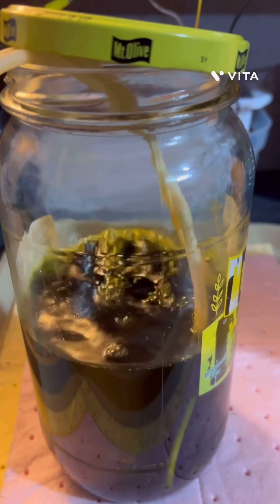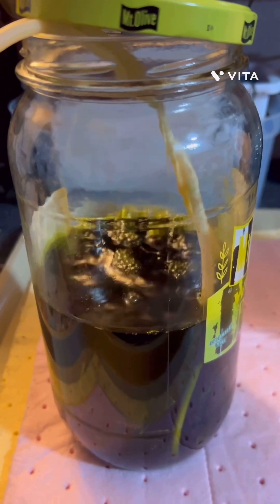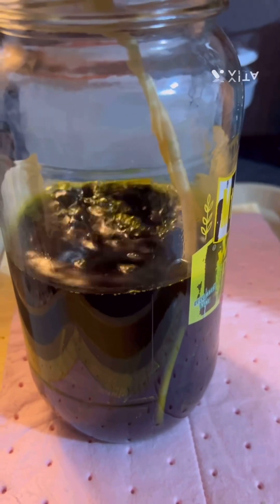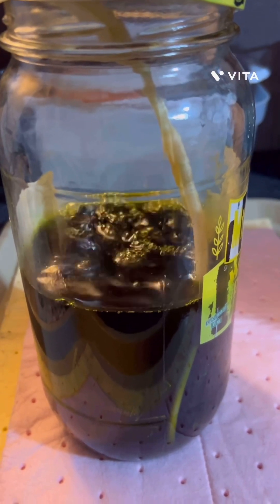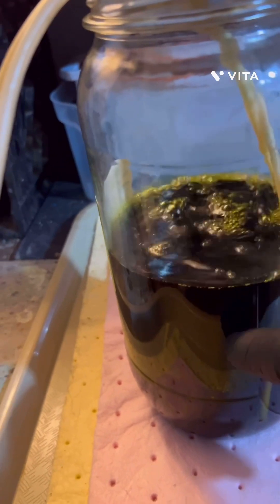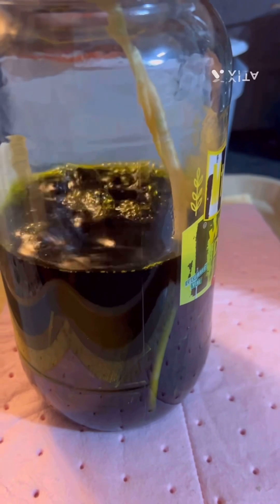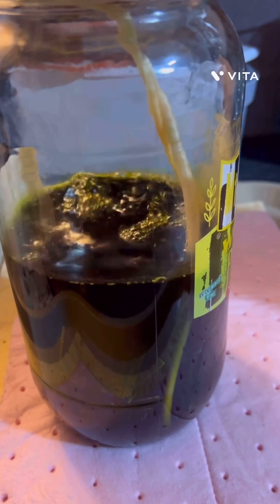This is going outside — it produces fumes. We're going to look at it every couple of days and see how it goes. That's the AP copper etchant; you don't need to add peroxide, just put the hydrochloric acid in with some copper in the bubbler and it'll do all the work. We'll get back to it — it'll probably be a little greener hopefully, but that's it.